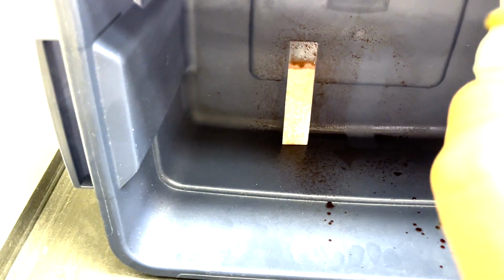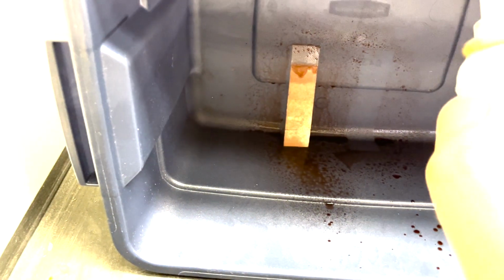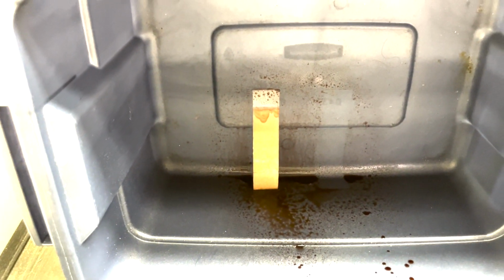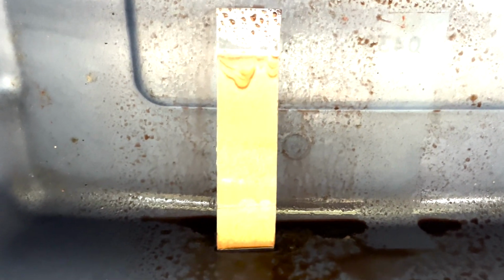But if you want to try something else, if you see something on Clark's that you want to try, I will try to find the ingredients for you and make it up. We've had students do that in the past. There's Van Urk's and Dragendorff, a bunch of other ones that you can try that act as sort of color tests in the sample, and oftentimes can give you better sensitivity or be more specific for the thing you're looking for. So here is that same plate we looked at before, but this time sprayed down with iodoplatinate.